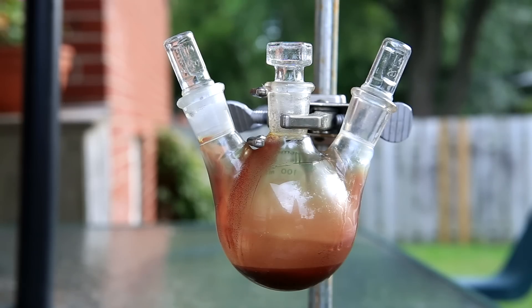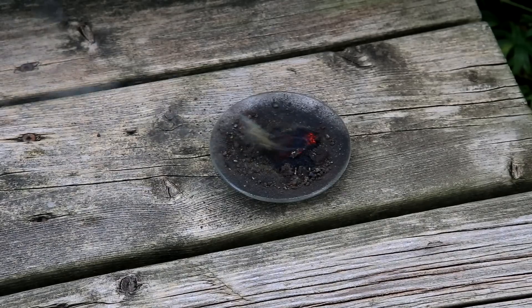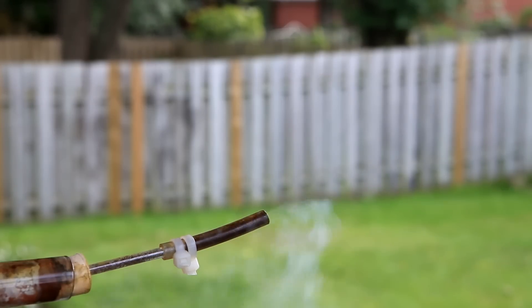This was my final yield of silicon tetrachloride — at least about 10 milliliters. This means only about two to three grams of silicon was used, so there was quite a bit of waste. The apparatus was dismantled but the silicon hadn't cooled enough, and the moment it was exposed to air it started to burn. Also, I removed the condenser and let the residual chlorine in the generator pump through the reaction tube, which made a nice little cloud of chlorine, silicon tetrachloride, and hydrochloric acid — and for obvious reasons I don't recommend doing this.